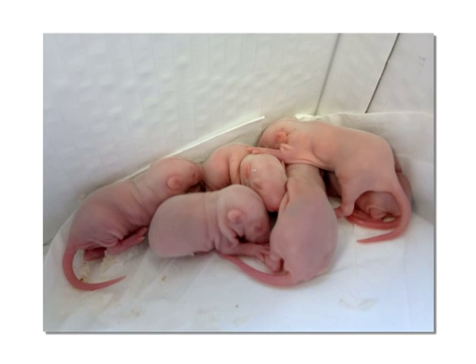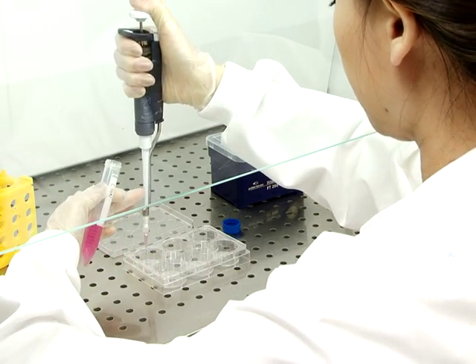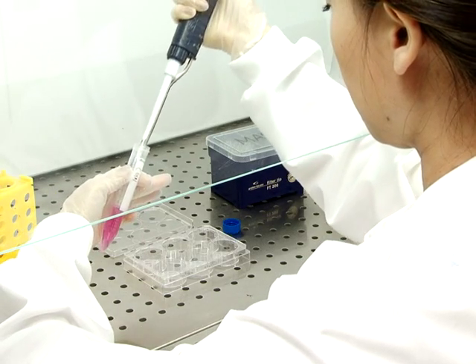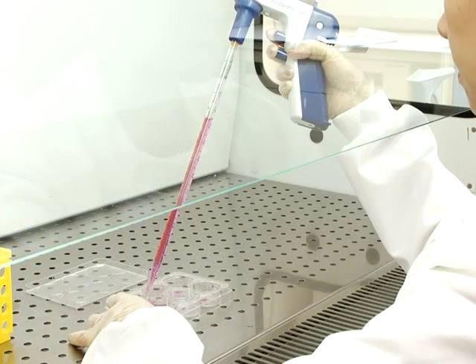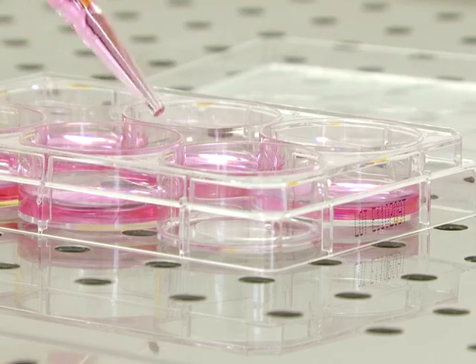Begin this procedure by using 7-day-old Sprague Dawley rat pups to prepare the primary cultures of cerebellar granule neurons. After the cultures have been prepared, plate the neurons in the center of a poly-D-lysine-coated 25 mm cover slip in a droplet not exceeding 7 mm in diameter. After 1 hour, add 2 ml of culture media to the neurons.